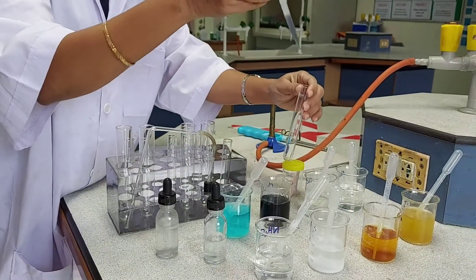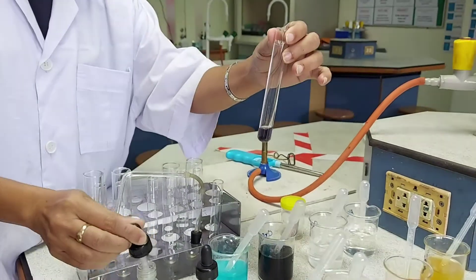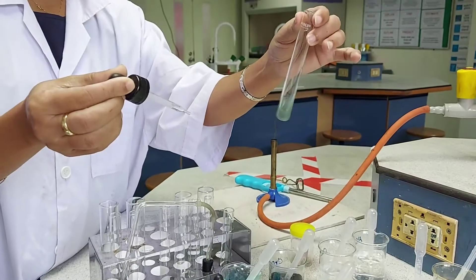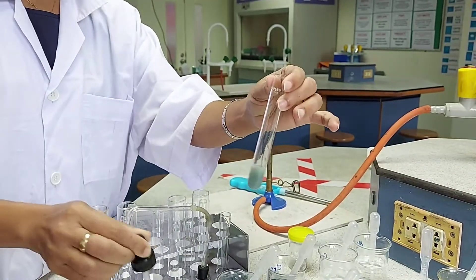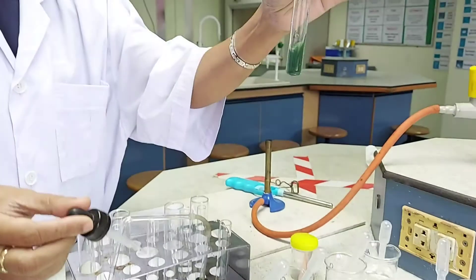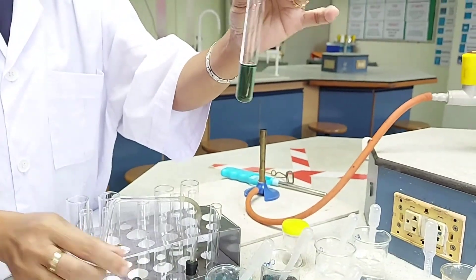The next solution — we don't know what it is; we have to find out what metal ion is present. When I add a few drops of sodium hydroxide, I get a blue-green precipitate. In excess, you can see the precipitate dissolves and you get a clear green solution.